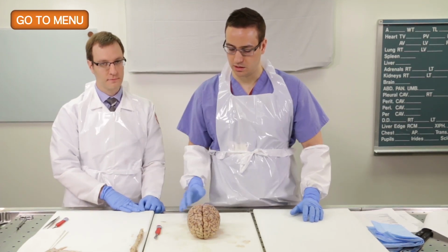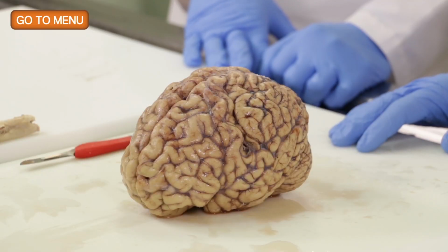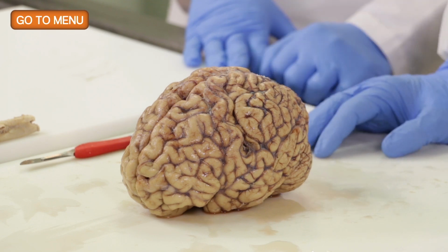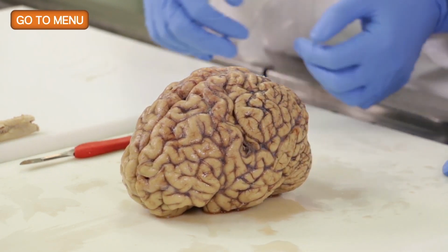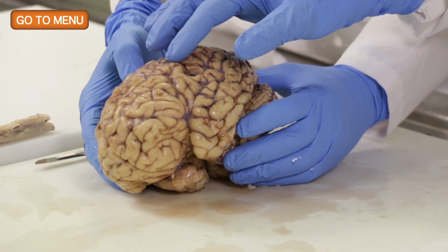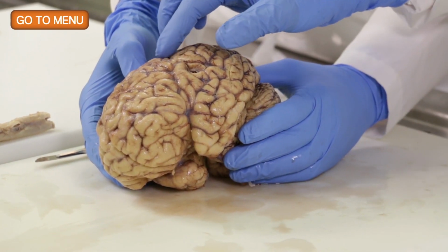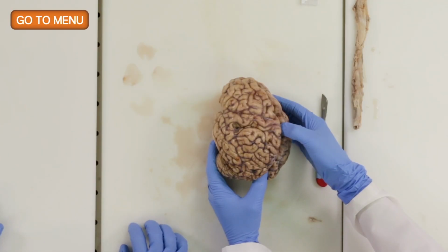We're just looking at the general structure of the sulci and gyri here. In this case, I don't see any signs of atrophy, but I think there's this notable finding on the left side of the brain here. Okay, so why don't we describe this? So there's this, it's a depression. It's slightly discolored, and I think this gyrus here is somewhat atrophied compared to the ones around it.